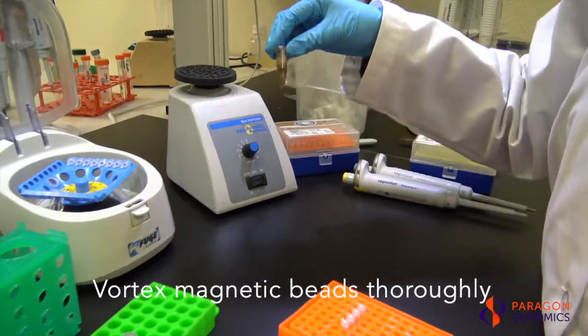As good practice, always vortex the bead aliquot thoroughly before every dispense to ensure that the beads are evenly dispersed in the solution.